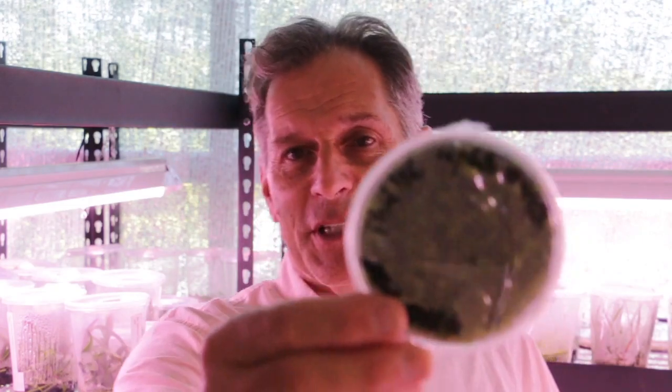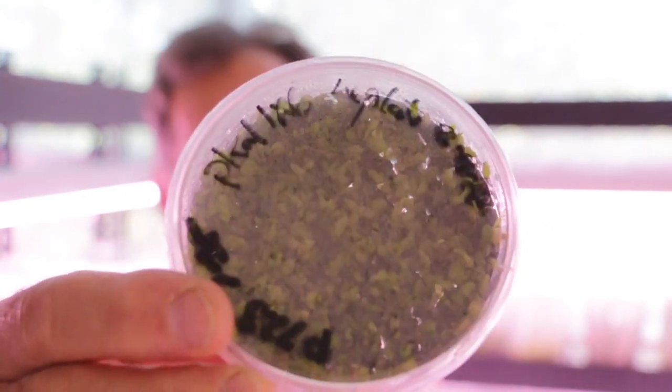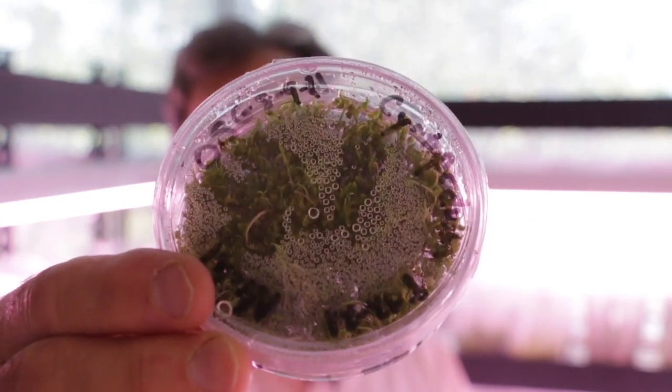So this is what you kind of expect. This is a Phalaenopsis seed plating, and this plate is just loaded. There are thousands of seedlings in this. Finally, this is an old plate of Cypripedium, and again, just thousands in here. And this is a small amount of the total number of seed that was in the seed capsule.